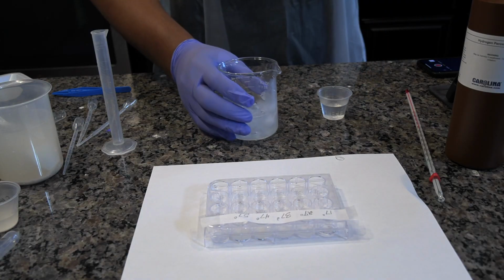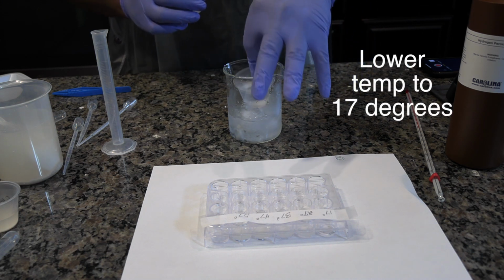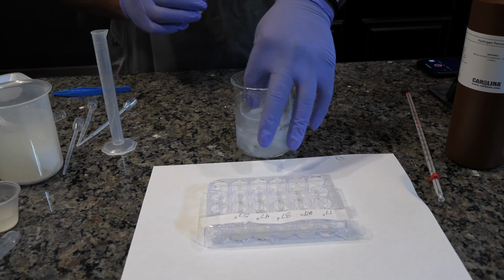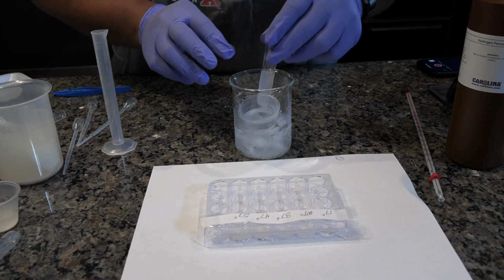For the below room temperature trial, set up an ice bath by adding an inch of crushed ice and water to the beaker. Place the medicine cup containing the 1.5% hydrogen peroxide in the center of the ice and insert the catalase test tube in the ice beside the cup.